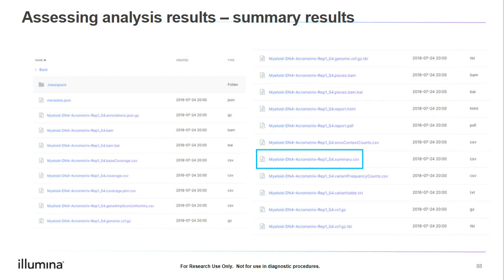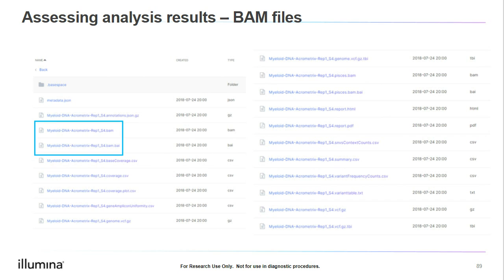If we go back to our list of files, there's also a summary.csv file. This file also includes the high-level metrics we have already reviewed, but in a .csv format. Two key files in the output are the BAM and the BAM index file, or BAM.bai. These are some of the primary output files of the alignment to the reference.